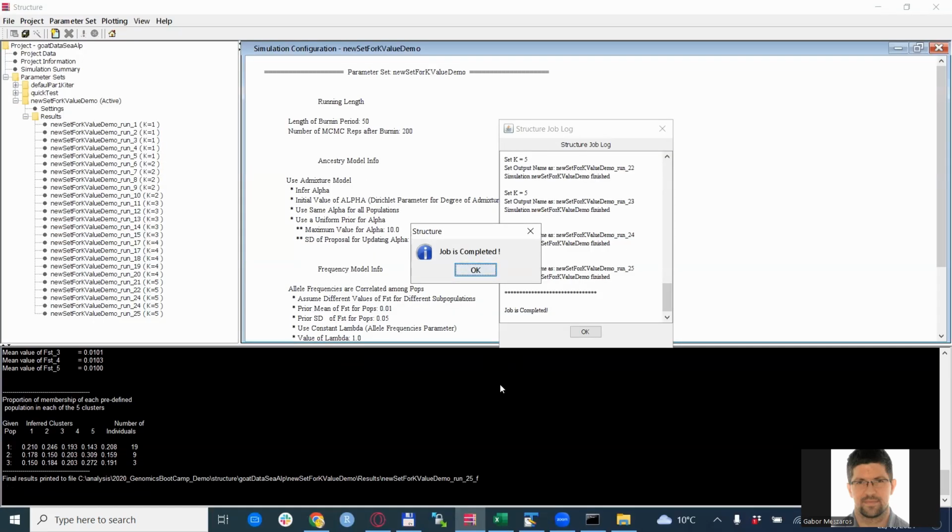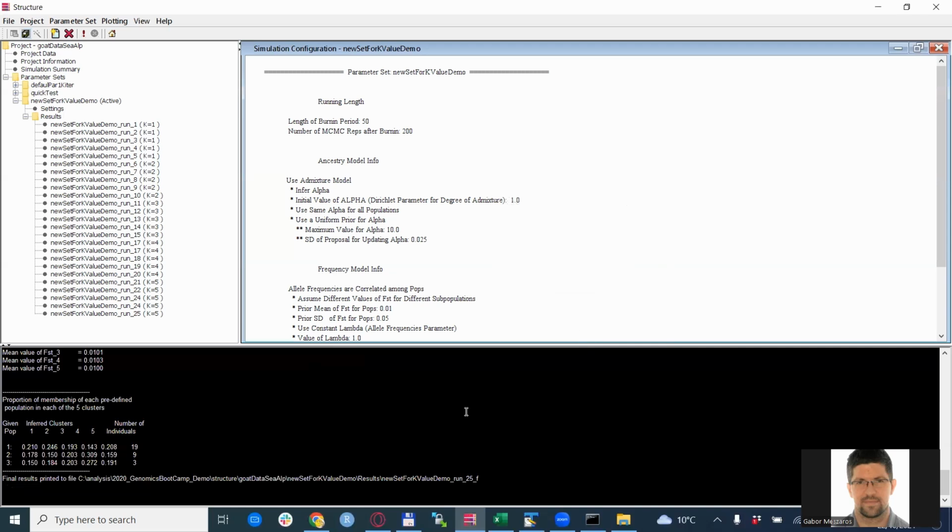After some time, the structure jobs are ready, and you get a nice job is completed message, which is of course great. We click OK, we click OK. And now we have everything ready to go forward.